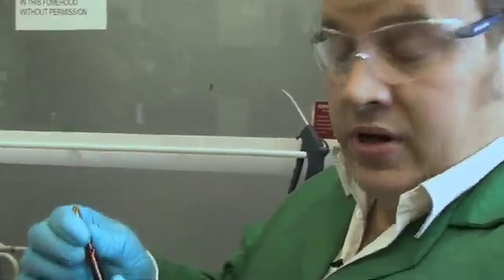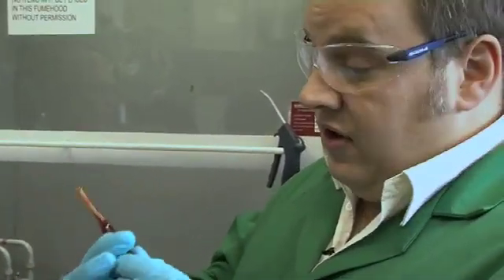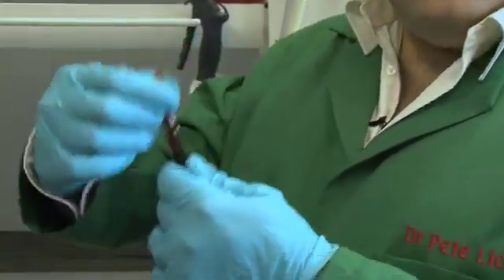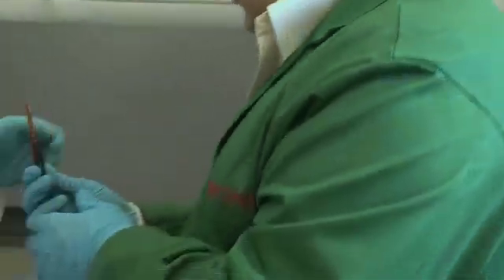We're going to get it out of this bottle now. It's sealed in because it's obviously very, very volatile as a liquid, and we're going to cut the glass, get it out, and then look at its chemistry. Thanks, Neil.